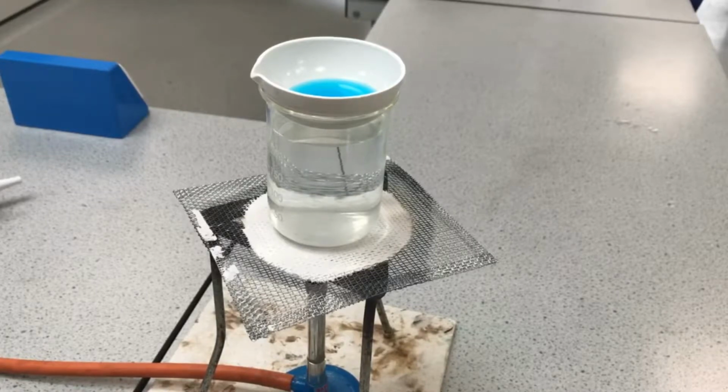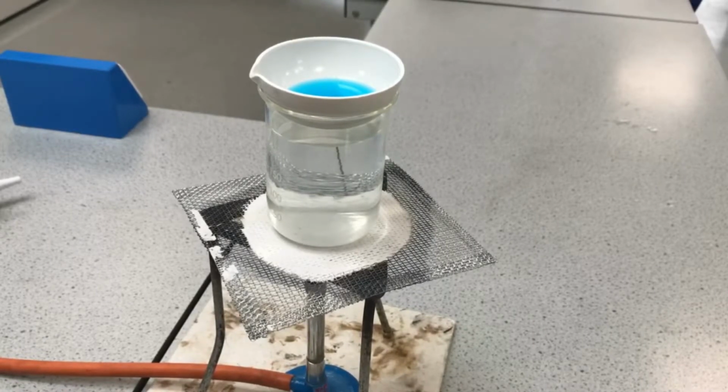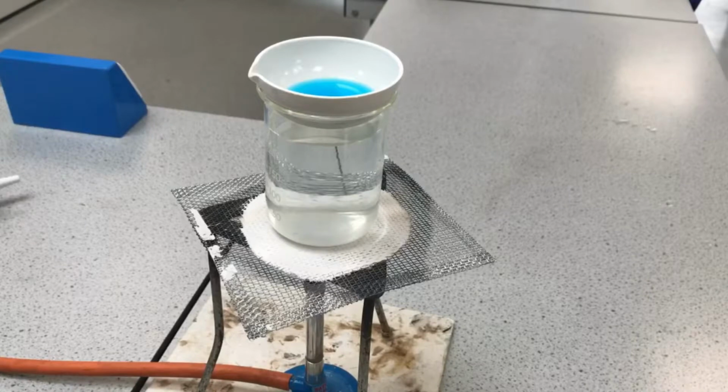It's basically using a beaker of hot water, in the way you would melt chocolate at home if you were doing some cooking. And this can gently heat the copper sulfate solution to get those copper sulfate crystals. The water's going to evaporate from here. I thought I could show you this because it's really useful for the required practical to know how you can get those copper sulfate crystals. We could just wait and get them with a bit of patience, but this is quite a good way of getting those crystals.